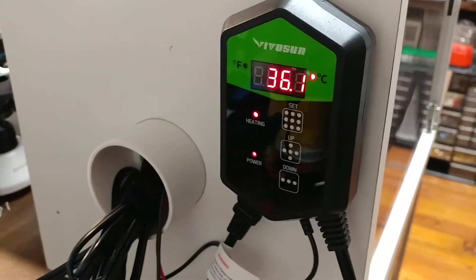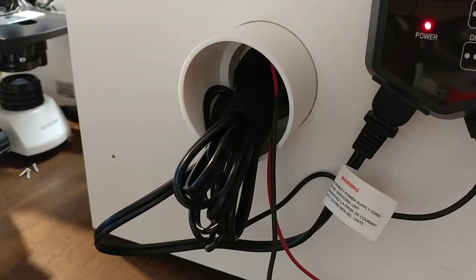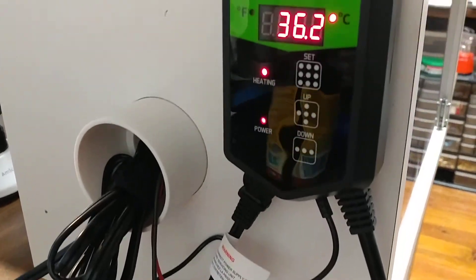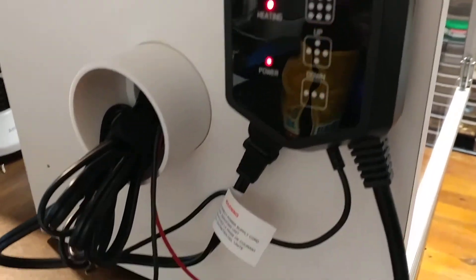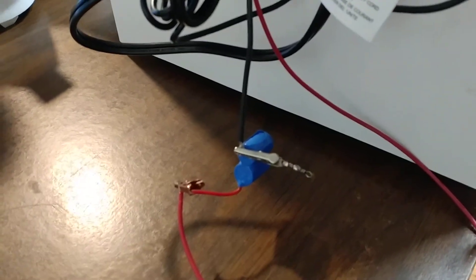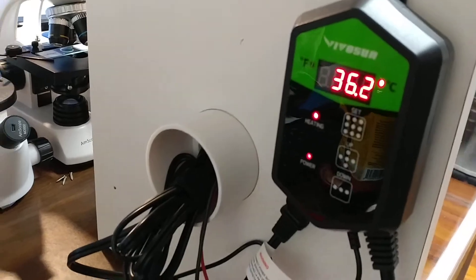Notice how the light goes off. I have the thermostat mounted on the side. The wire is just coming out there for now. If this works well, I will eventually make the wires go away. I just have that set up right now for a little 12-volt source for the light, but that will also be AC-powered.